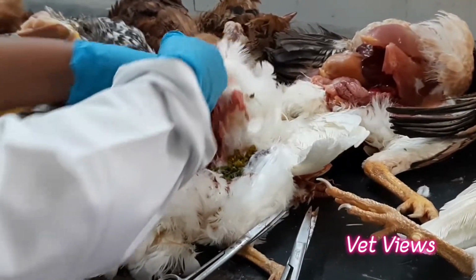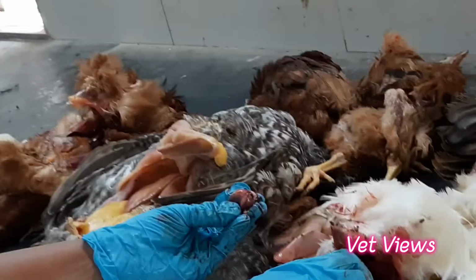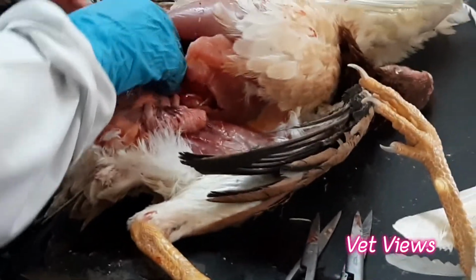In the heart, in the epicardium, there is a little bit of fat. This is epicardial fat. In this place you have to look. It is not an exclusive indication, but you can link it. And down from it you have to go to the intestines.